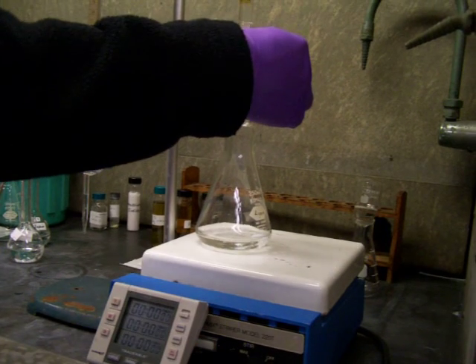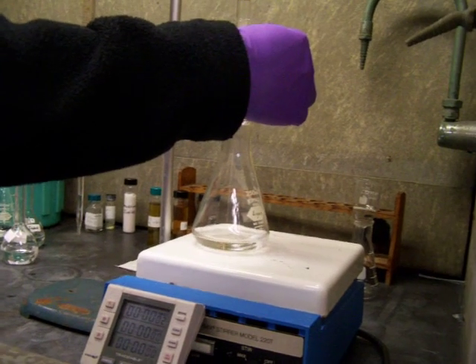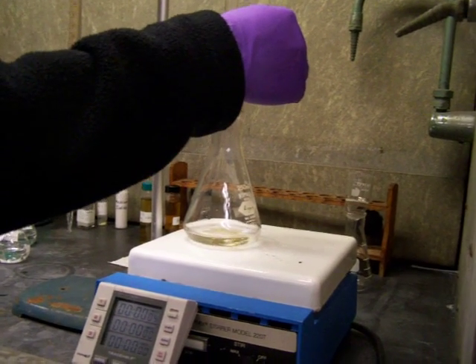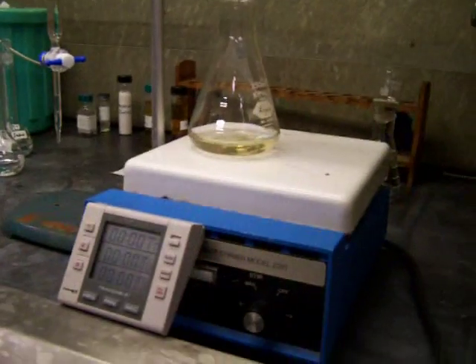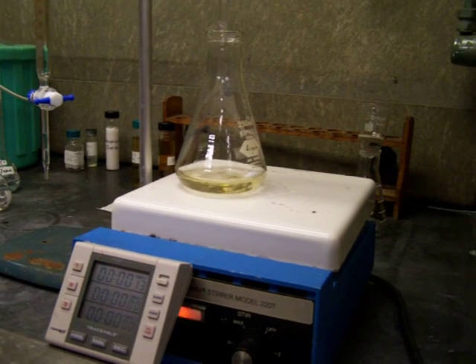Go. That's a too high rate. It's yellow already? Yeah. Okay, first 10 seconds, slowly.